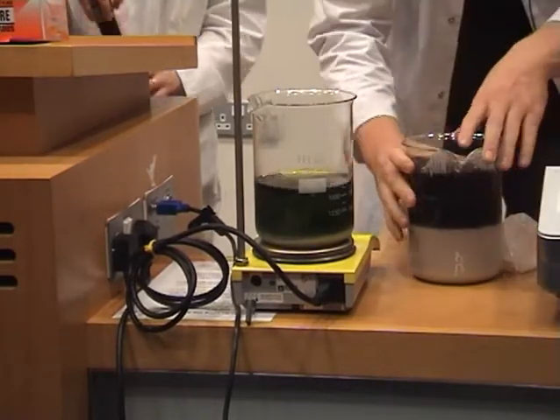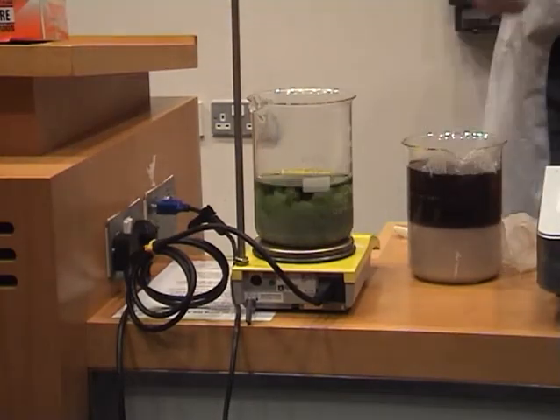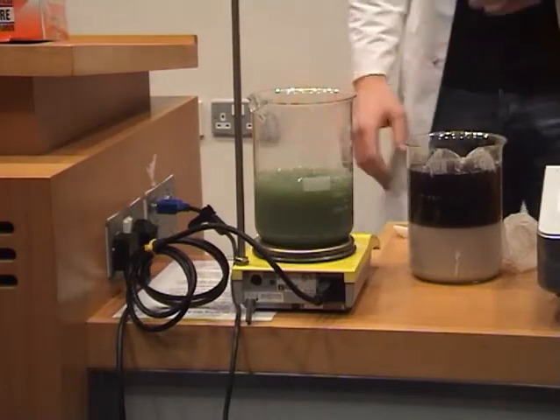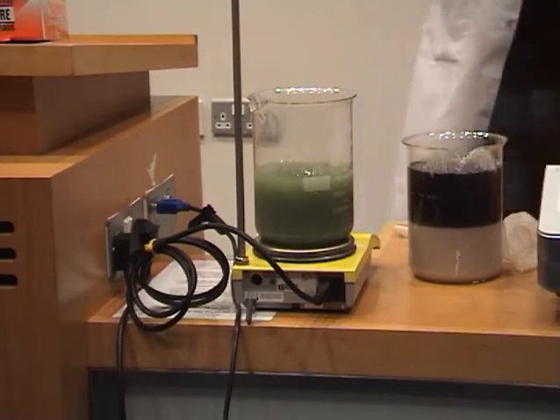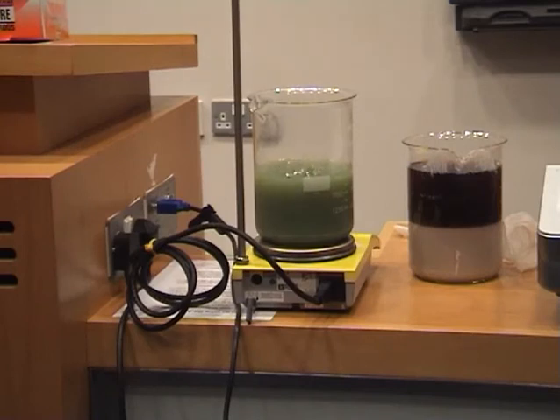Okay, so basically what I have here is a magnesium solution. Now it's magnesium hydroxide, so that's the base. So our base colour over there was blue, so we have a greeny blue here, with the universal indicator in here. So the indicator shows the colour range of which is an acid or a base. So we see here, our base here is blue, our neutral pH is 7, that's green, and then our golden yellow colour, that's our acid. So now, I might put my acid in here.